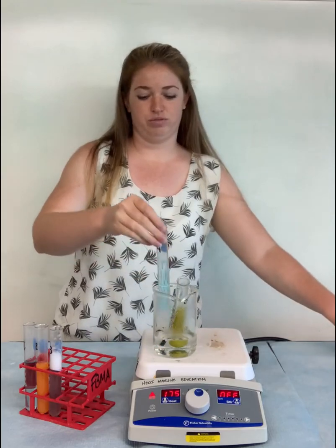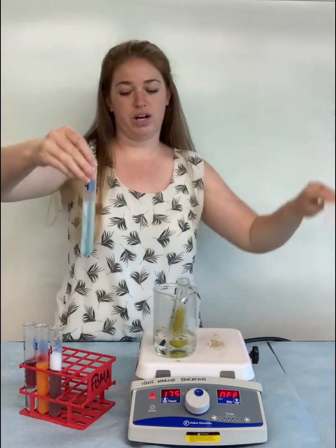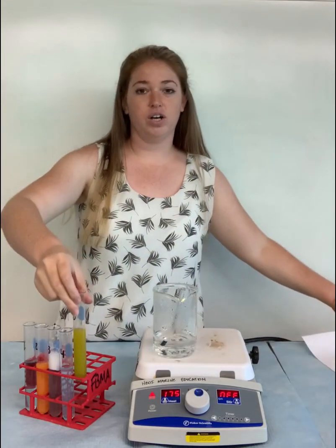Let's take a look at test tube number 4. So again, we have our light blue color. That's from our Benedicts. No color change here, so that's going to be a negative result for simple sugars. And lastly, test tube number 5. Now, if you remember, test tube number 5 contained our cooking oil, which was yellow, and again, we added our Benedict's, which is blue. So a yellow or green color is not indicative of monosaccharides here, simply a result of adding yellow and blue solutions together. So our 5th test tube is also a negative result for monosaccharides.